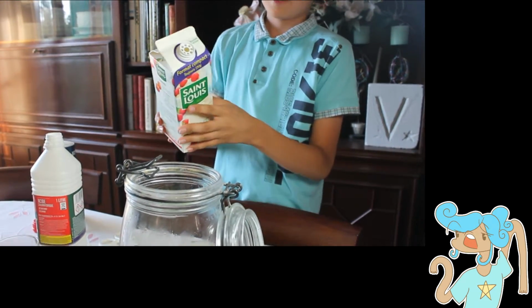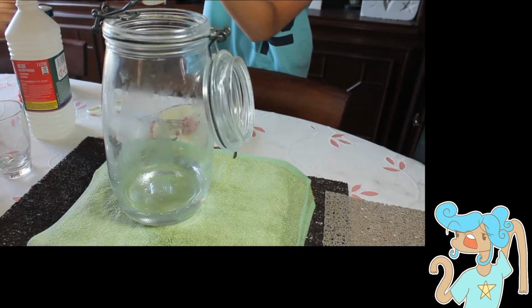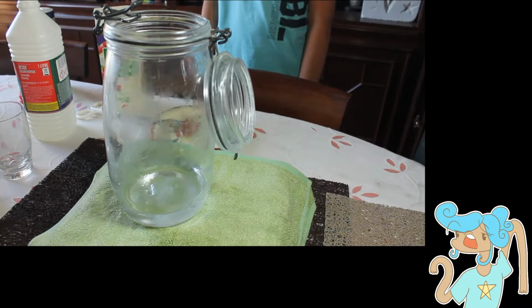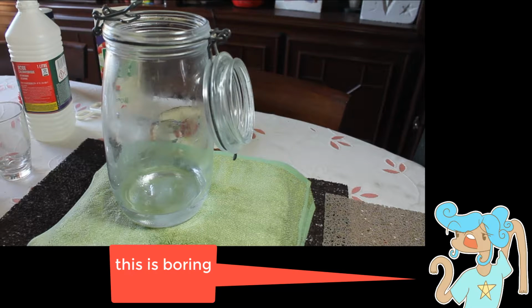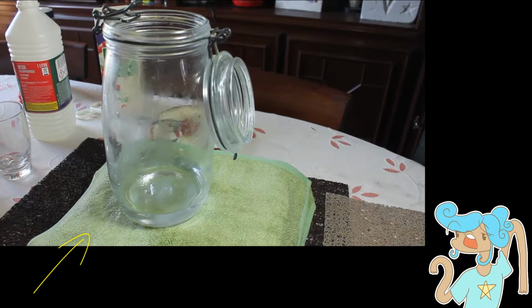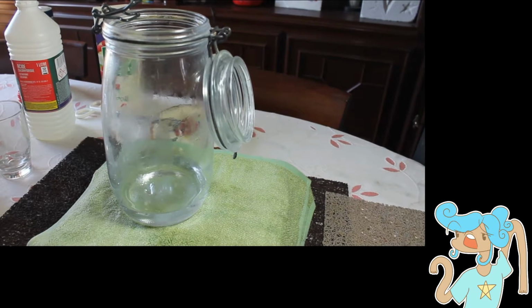And we start with the sugar. And we have sugar at the bottom of the container with acid on top. The sugar doesn't seem to be bothered. And we'll stop for now.